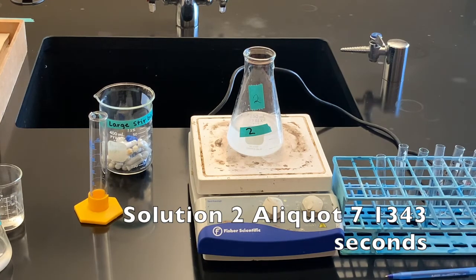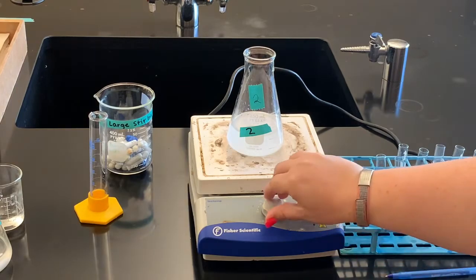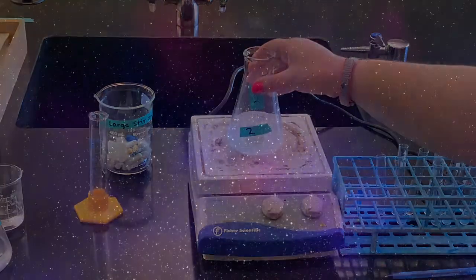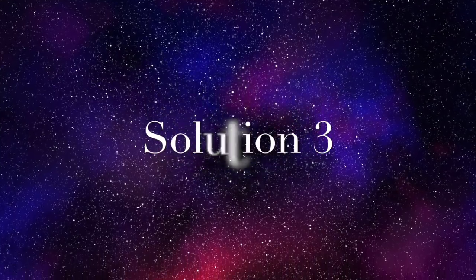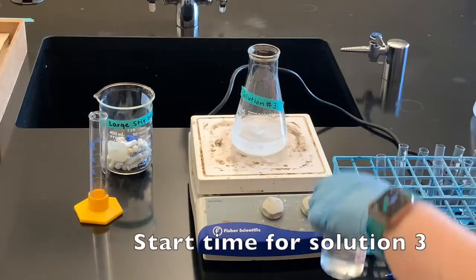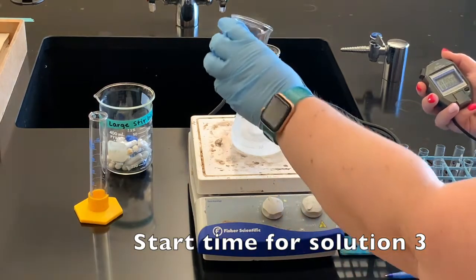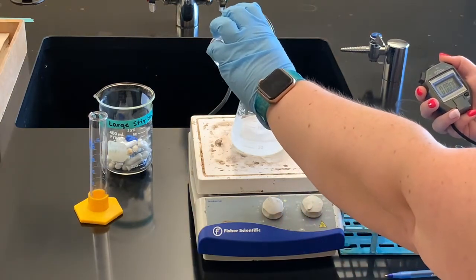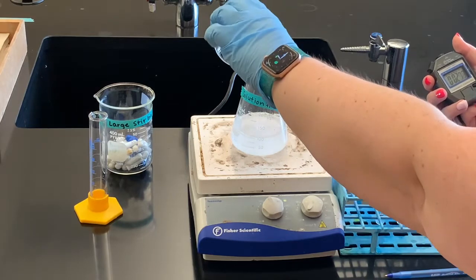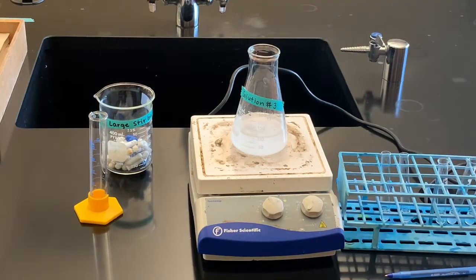That was aliquot seven of solution two, so we're going to move on to solution three. When I pour the beaker in, time is going to start.